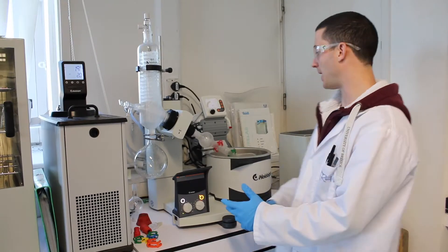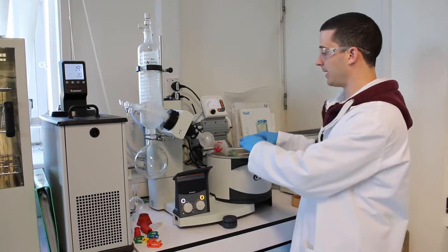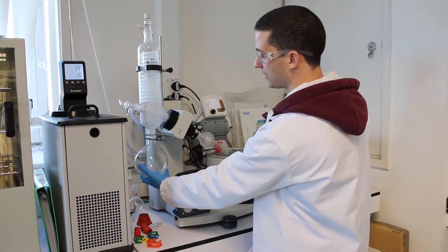Okay, the system is now at equilibrium. Our water solution is boiling and the vapors are now recondensing inside the collector flask, as you can see.